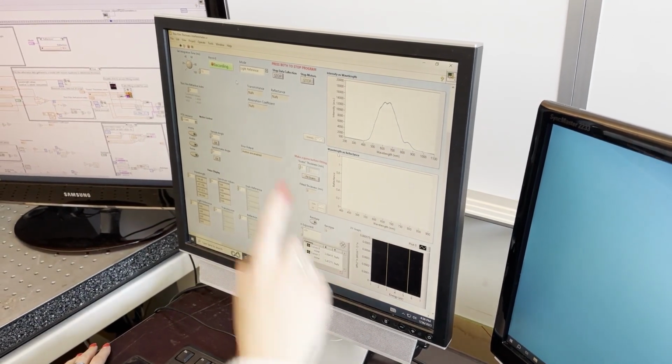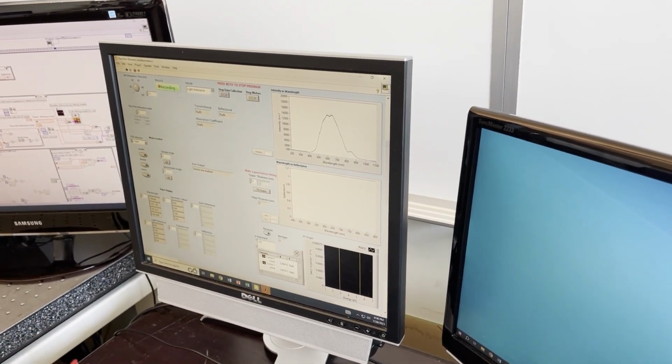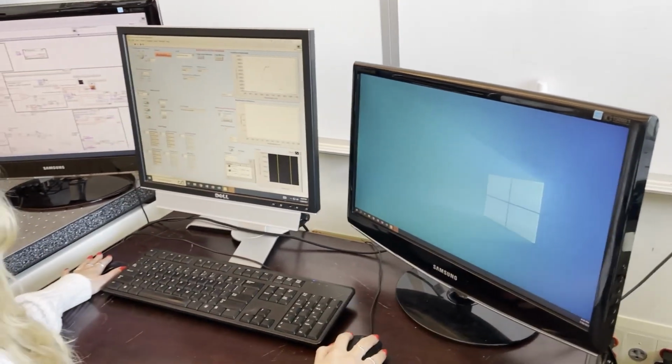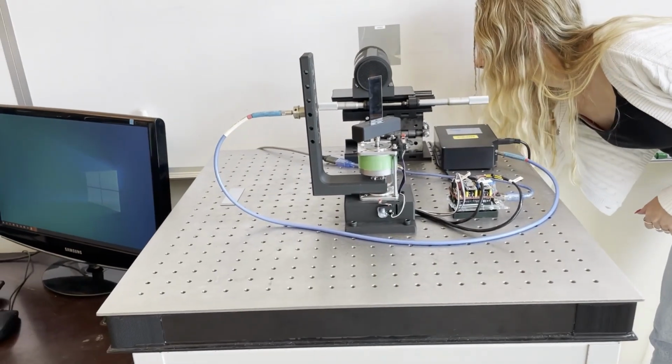Hit light reference mode, and it should keep the measurement. Once you're satisfied with it, stop recording. Then you're going to want to change the modes to dark reference. Go over here, keep the substrate in still, just turn off the light.